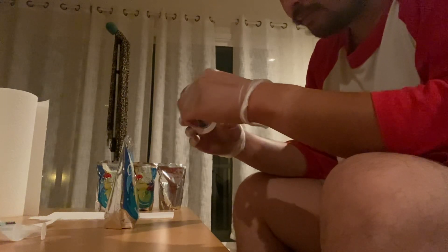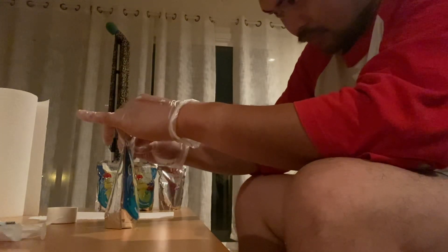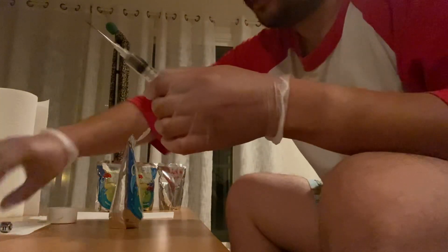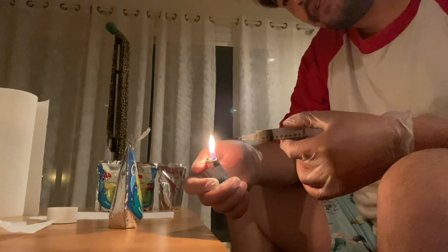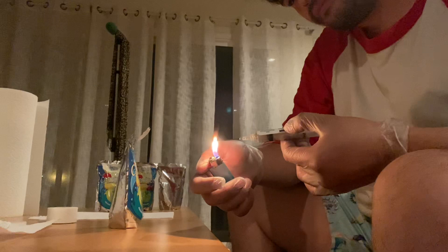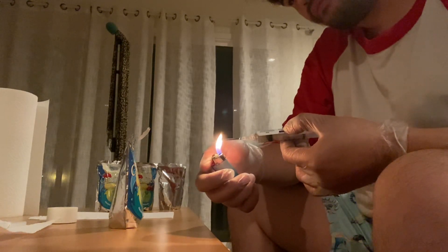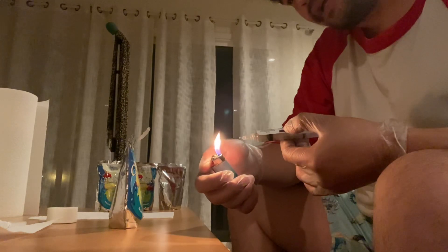Get our tape ready first. Clean, sterilize the needle until it's red hot.